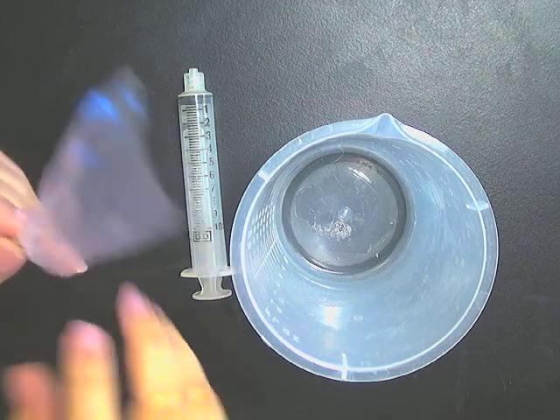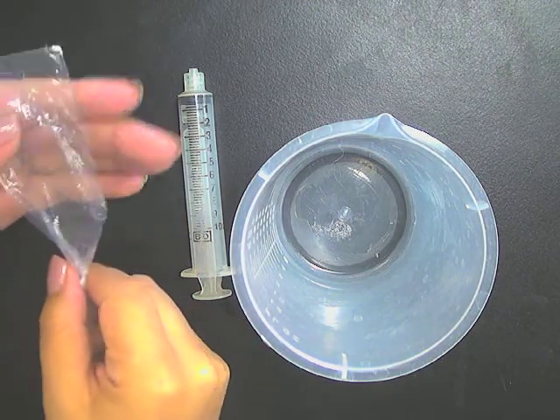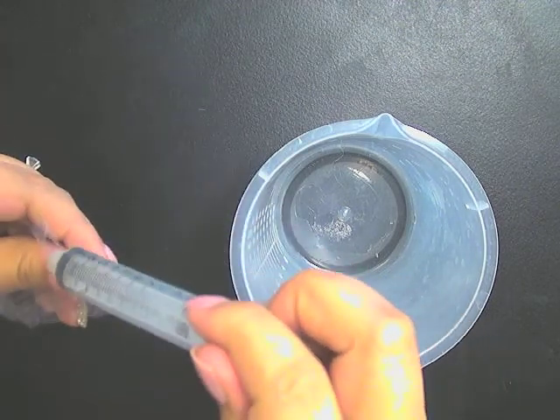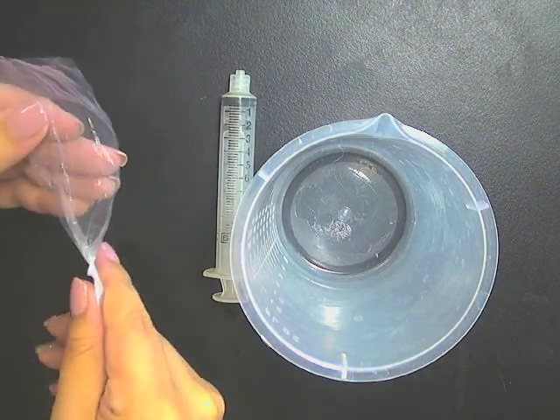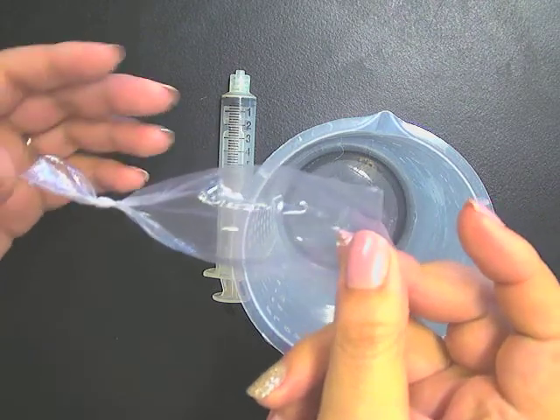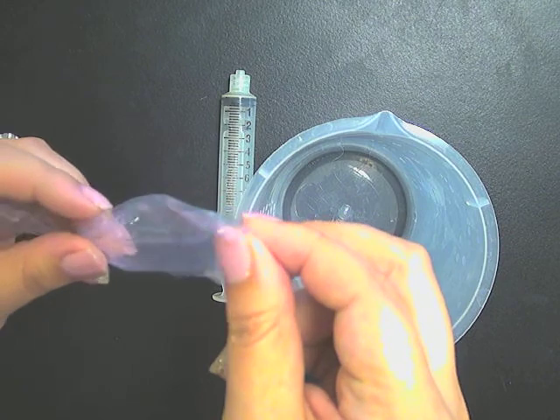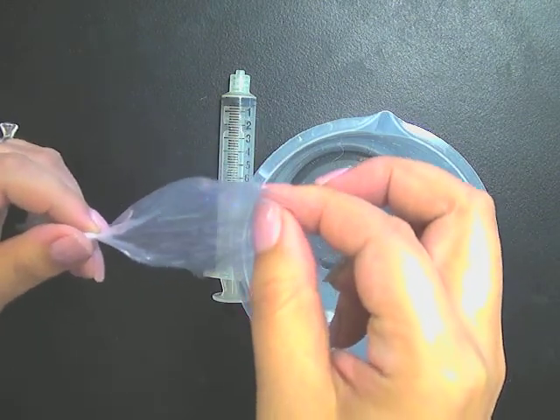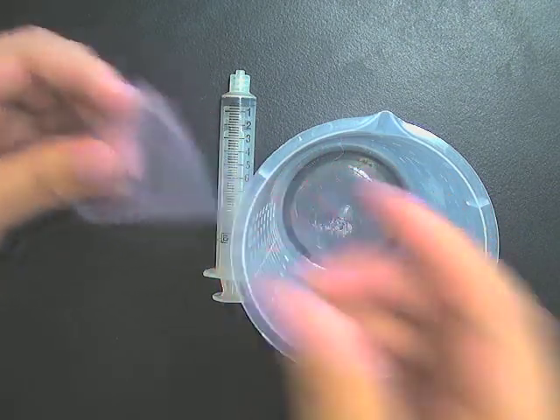Now, for this experiment, the control, let me back up. You're going to tie off this bag. You're going to fill it with 10 milliliters of solution. Note that the dialysis bagging is a little tricky to manipulate. One end will already be tied for you, as shown here, and then the other end you are going to have to rub a little to get it to separate. It's very tricky to do, but trust me, it will separate. Just keep rubbing on this end. You may need to get your fingers wet a little, and then it'll separate.